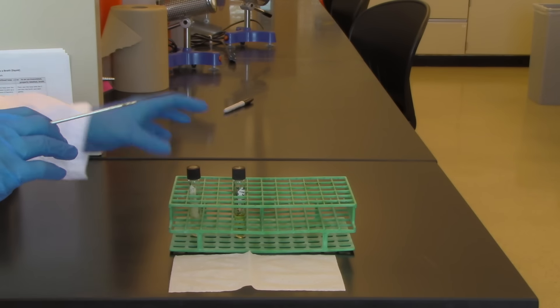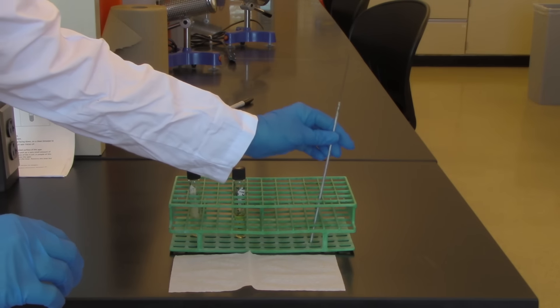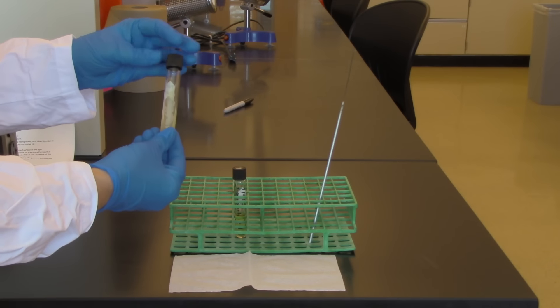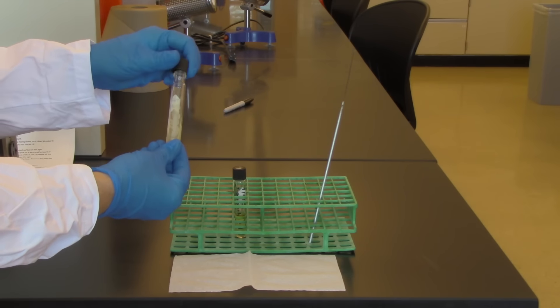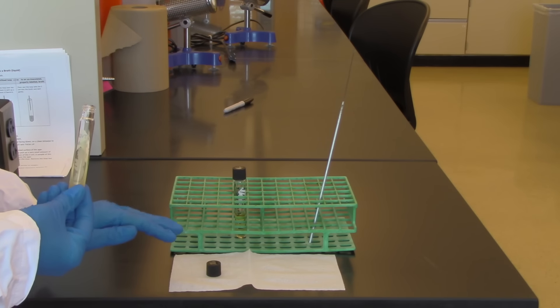I'm going to have my sterilized tool and I'm going to be using a loop here. I'm going to put that aside. I'm going to remove the lid from my culture and I'm going to put it top down on a kim wipe, a clean kim wipe.